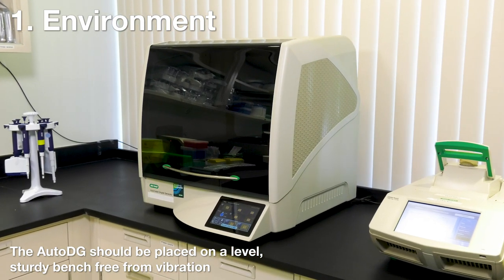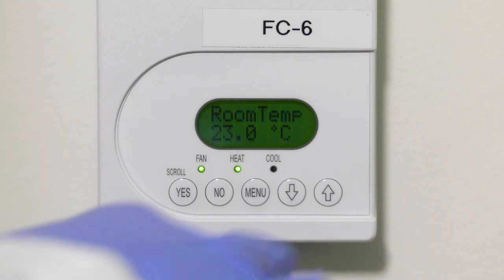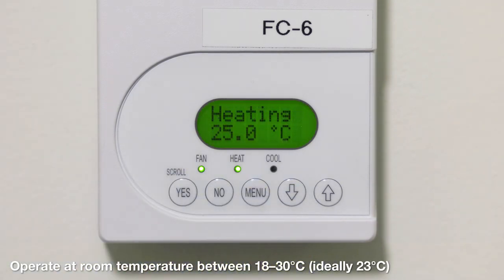Before you begin, make sure the instrument is placed on a bench that is very level, sturdy, and free from vibration. The temperature of the room should be between 18 and 30 degrees Celsius, ideally 23 degrees Celsius for optimal performance.